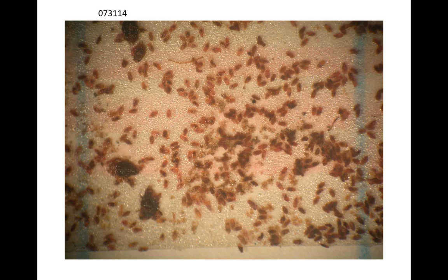So when you stick this on the blue line paper, does it matter which side? I usually stick the side that was taped to the tree down on the paper. But these tapes really aren't stuck that hard to the paper. You can nick a corner and peel the whole thing off.